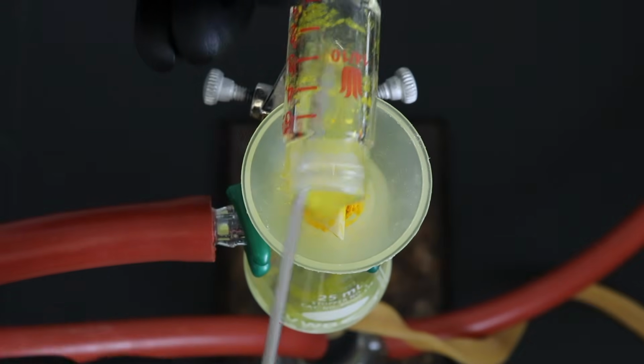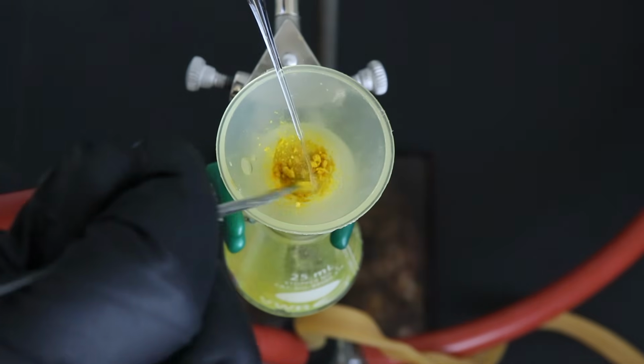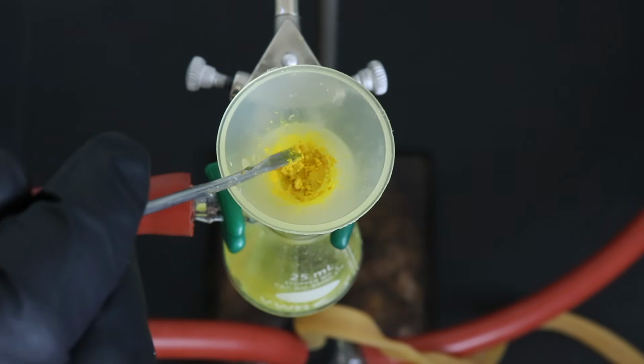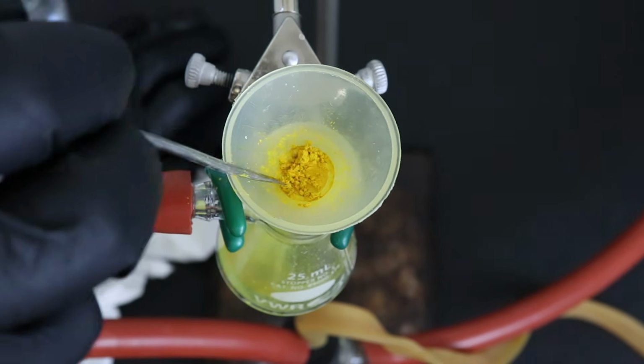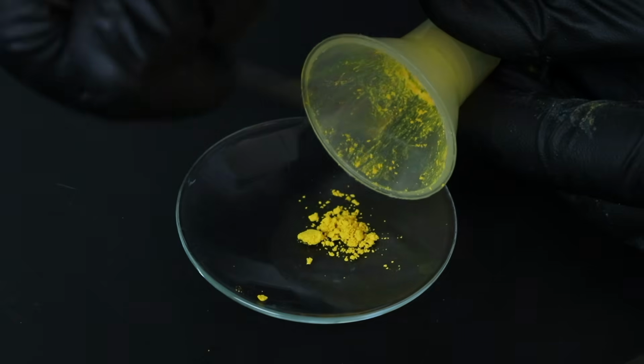I'll rinse the conical vial with some sodium bicarbonate, as well as the solid on the Hirsch funnel to help remove any acid that would be left over, and I'll also rinse it with some cold distilled water after that. The solid can be stirred on the Hirsch funnel until it's nice and dry. Then I'll remove it from the funnel so that I can measure the melting point range.